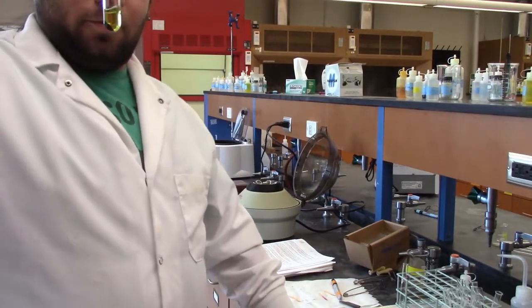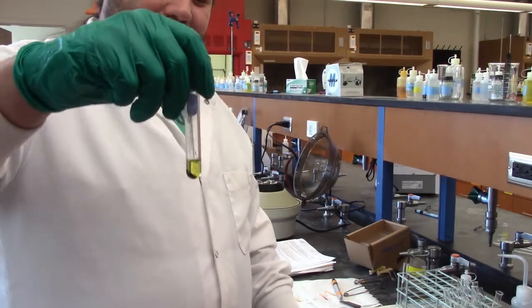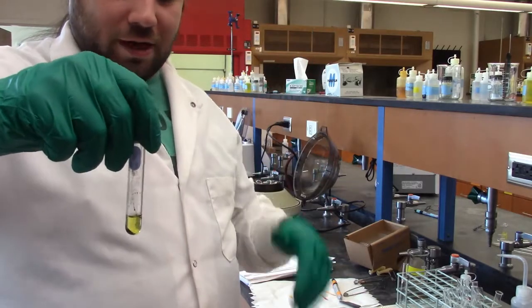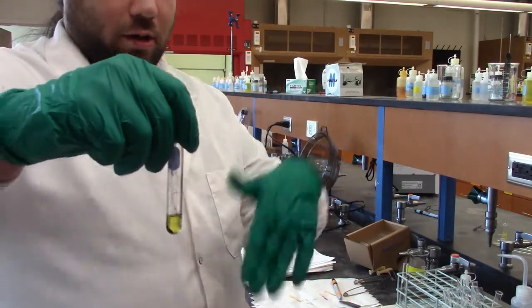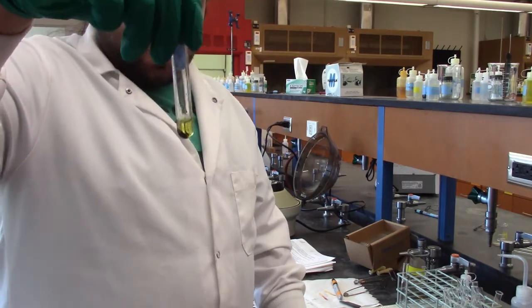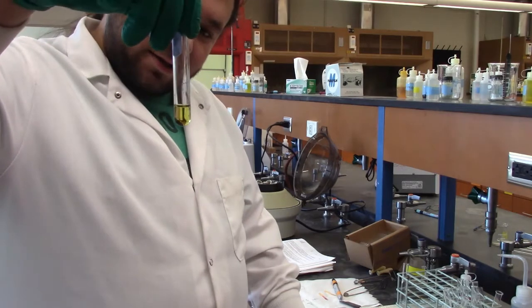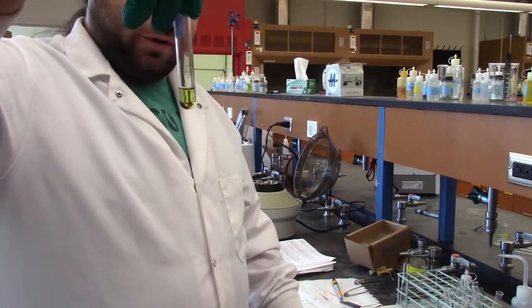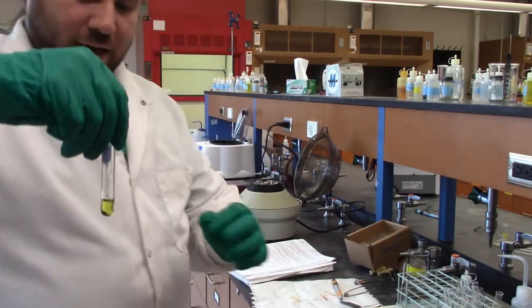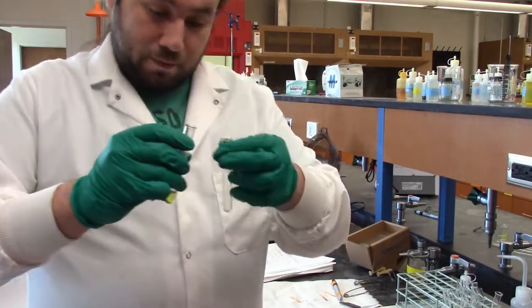All right. So as we discussed earlier, we put the KOH in there and all the other stuff, and then we ended up with the complex ion for tin, which is in the solution and it's giving us that kind of yellowish color. And then that black precipitate, that I'm going to try and stop shaking because it's starting to come loose, is all of our other sulfides. So we're going to decant that, and we're going to save the supernatant for later. And by later, I mean the next thing we do.